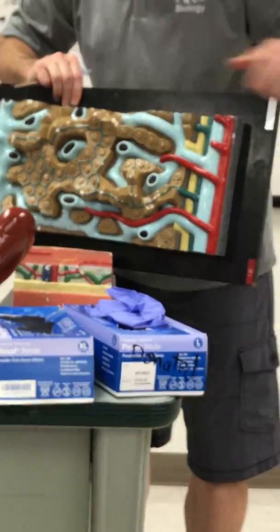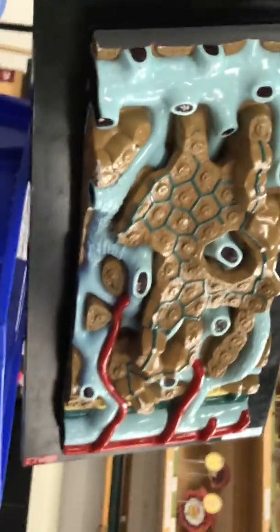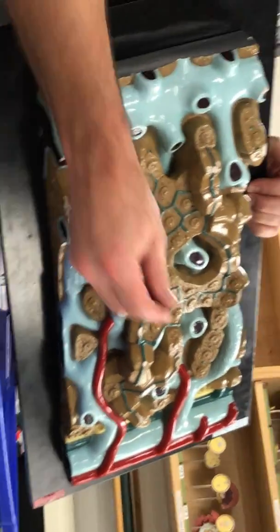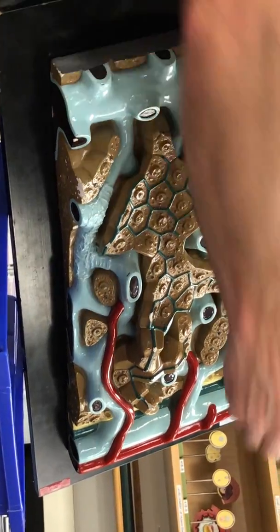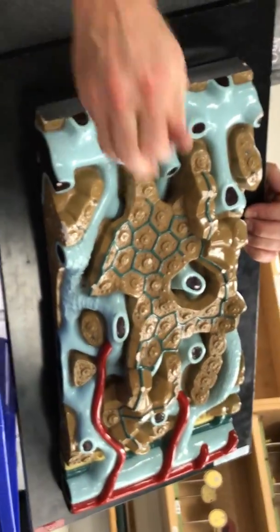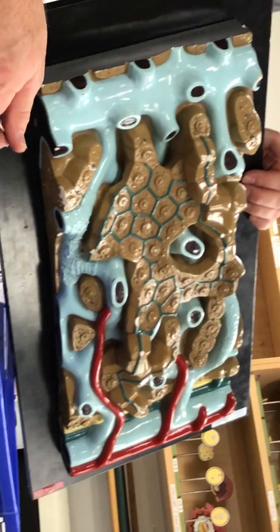And then all the brown here, they're cells. Hepatocytes. And running between hepatocytes are these light blue vessels, and they're going all the way from the portal triad to the central vein here. Sinusoids. They're sinusoidal capillaries. Lining the sinusoids are immune cells.